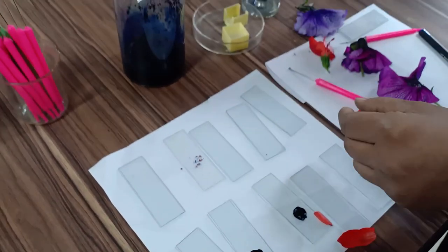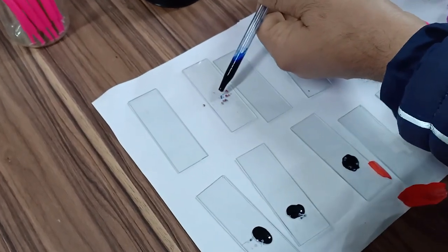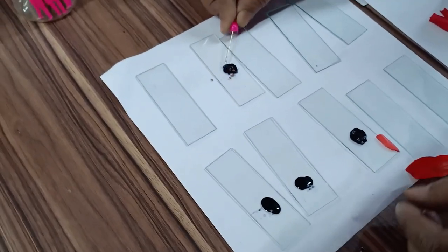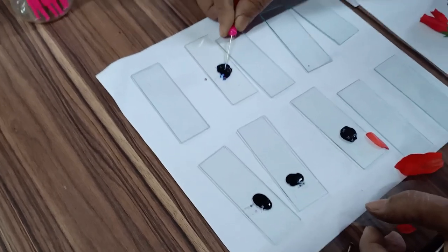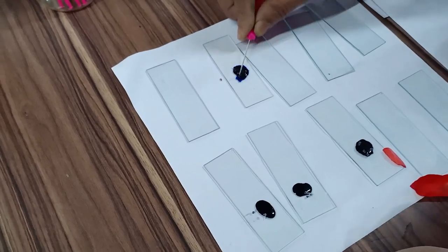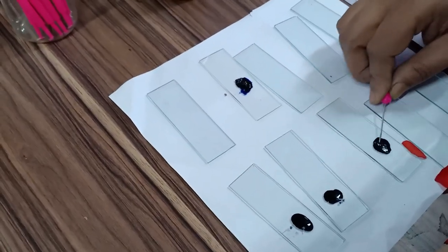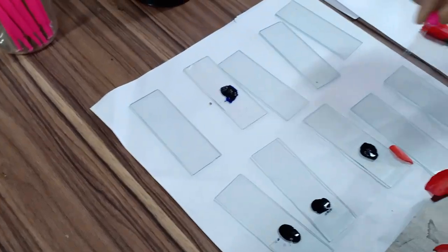Add one more drop of Evans blue for the China rose pollen grains. Mix with the needles, then try to remove any solid materials — the body parts of the anthers. After staining, place cover slips on the slide.